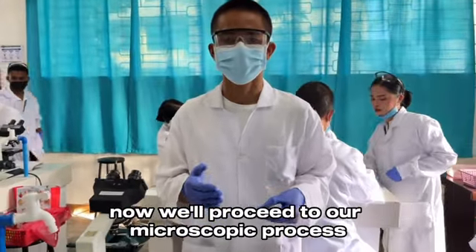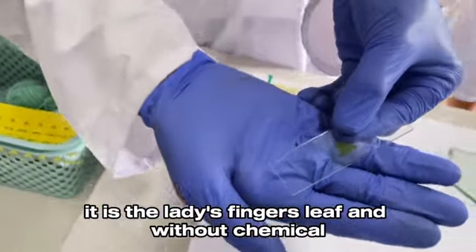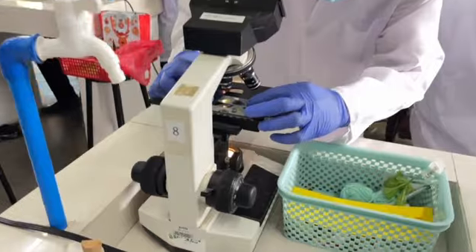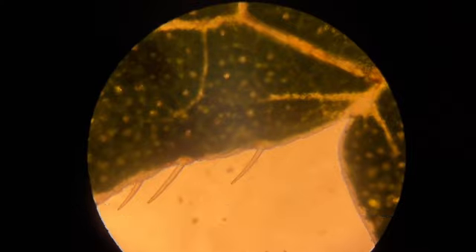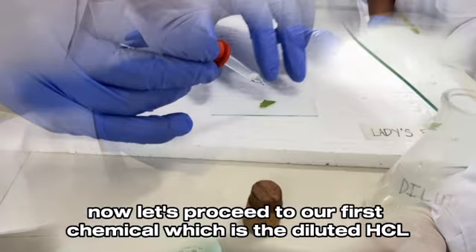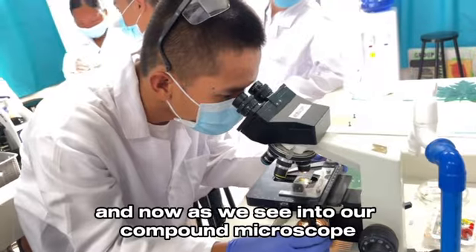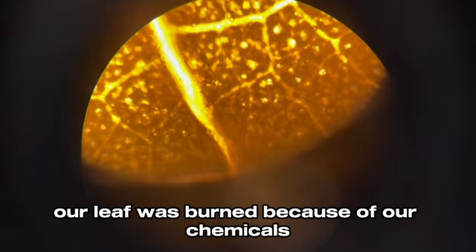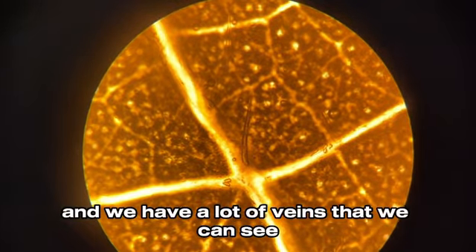Now we'll examine our first specimen, the lady's finger leaf, without chemical. As we see in our compound microscope, it has transparent trichomes. Now, let's proceed to our first chemical, which is the diluted HCl. As we see in our compound microscope, our leaf was burned because of the chemical, and we can see a lot of veins.